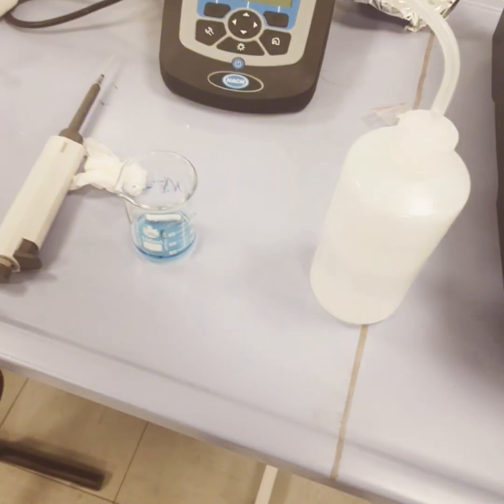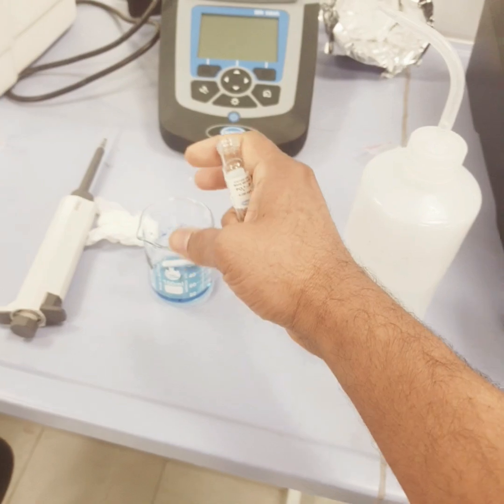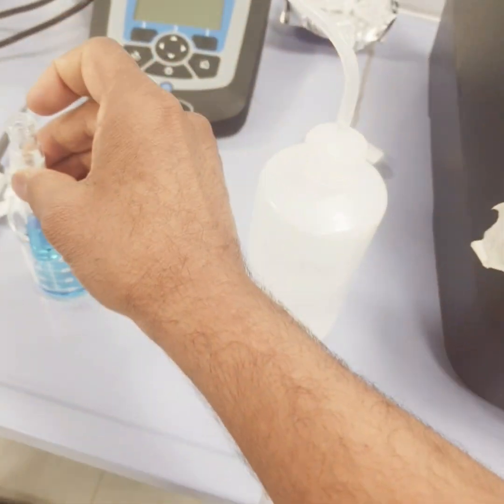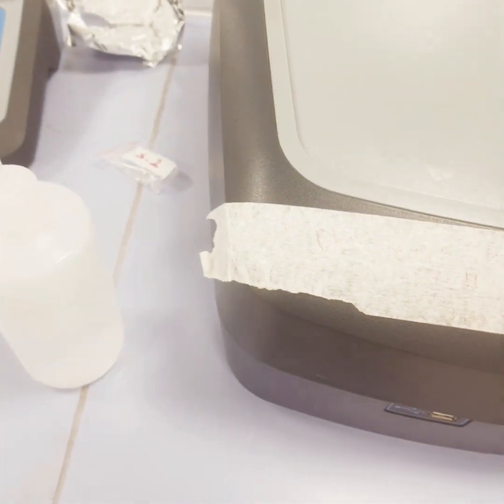Now again after two hours, since this is my membrane so we don't need to centrifuge. So I have transferred this sample here, then let's check the concentration.